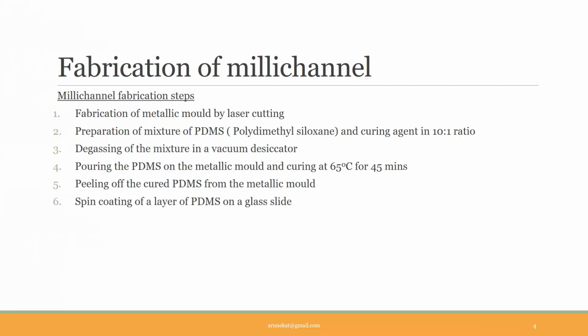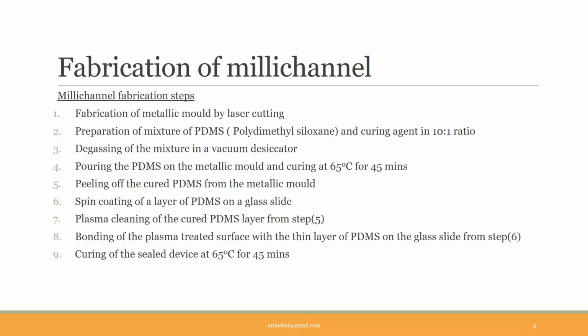Now, we take a clean glass slide and coat a thin layer of PDMS and curing agent mixture on the glass slide using a spin coater. After that, we have to treat the cured PDMS layer, which is peeled off from the mold, to plasma treatment. Plasma treatment helps to bond or stick the PDMS layer to another PDMS layer or glass to have a tight bond and thus a leak-proof channel. After plasma treatment, the cured PDMS layer has to be sealed with the glass slide coated with the thin layer of PDMS. Again, cure this sealed device in an oven at 65 degrees Celsius for 45 minutes. Then put inlet and outlet connections for the fluids to enter and leave. And now the device is ready to use.